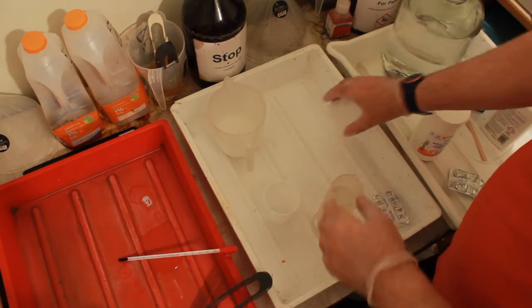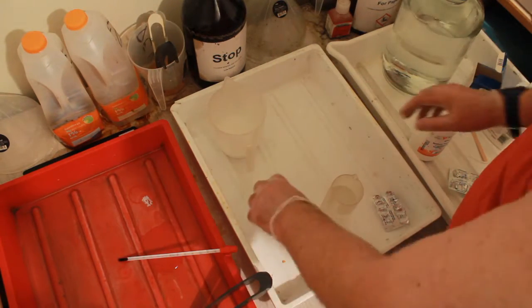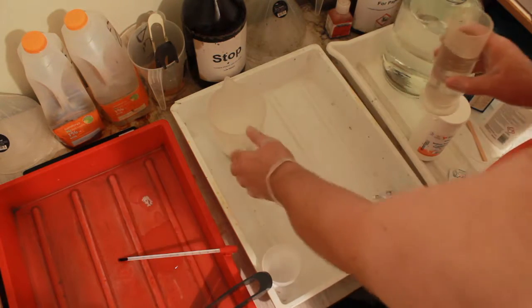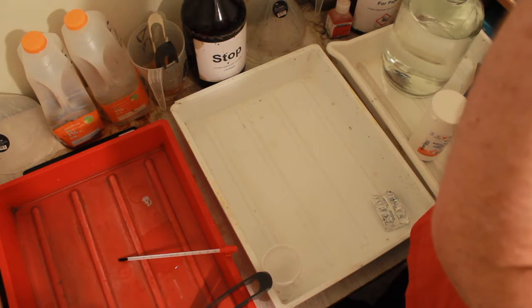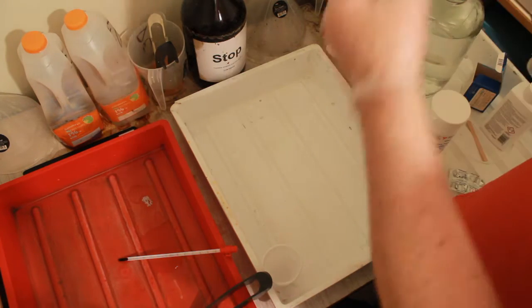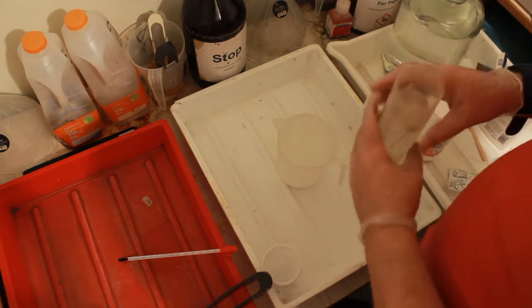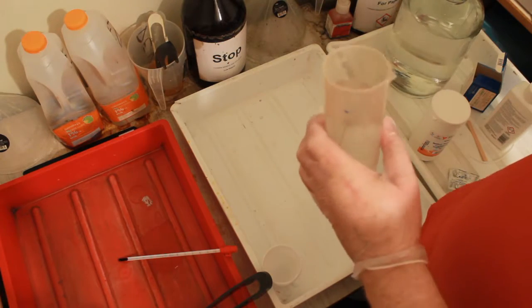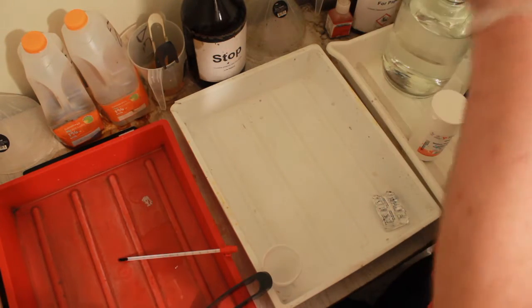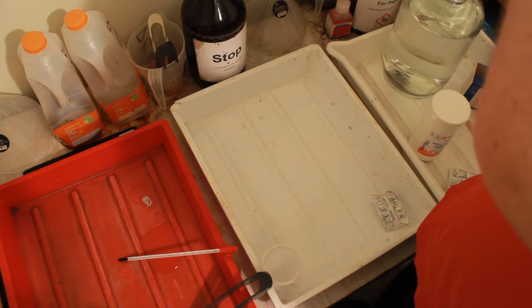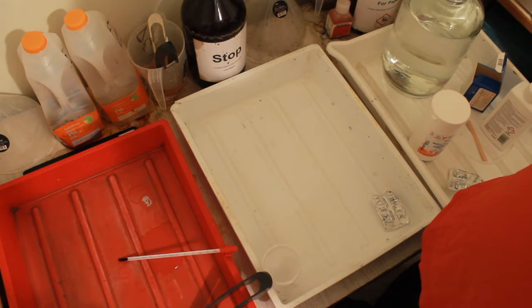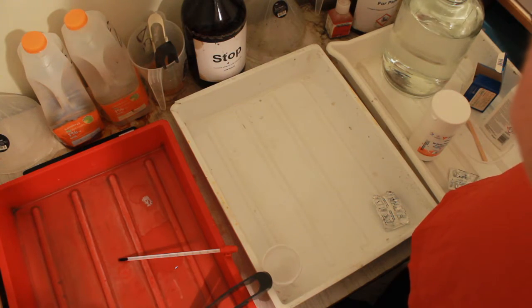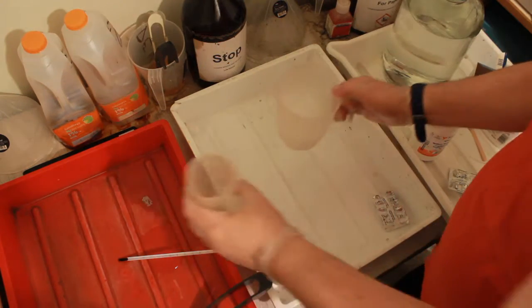That's come out clean, they can be dumped. And now we make this up to 500ml and give it another stir. I can't see the markings. Yeah, it's just under 300. 400. There we go, that's 500ml in there.